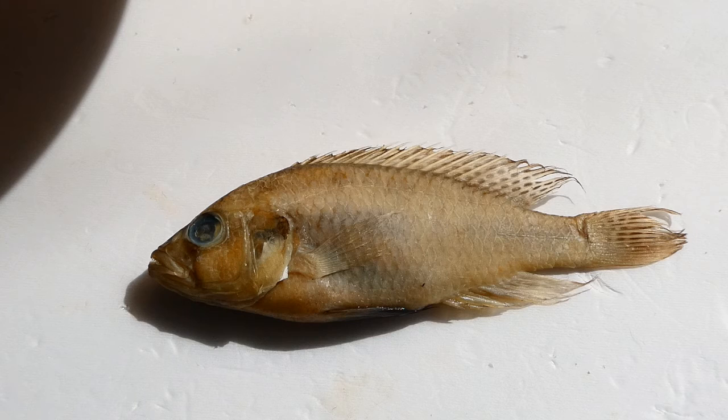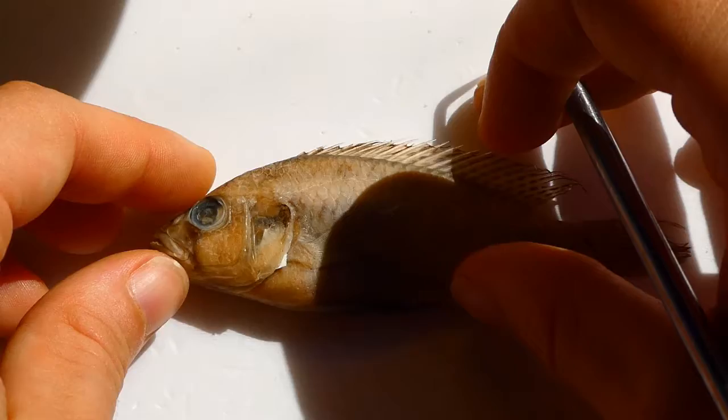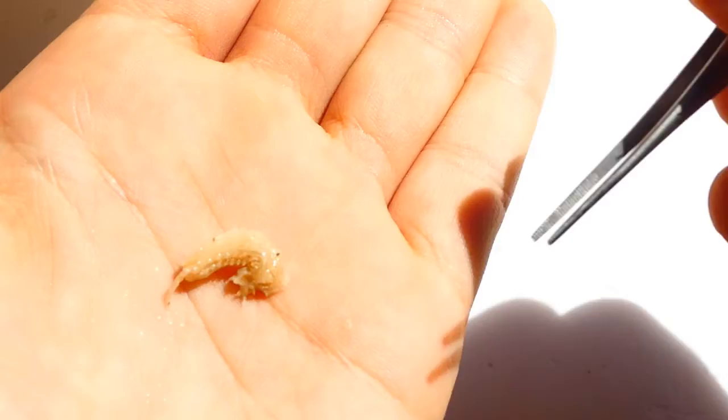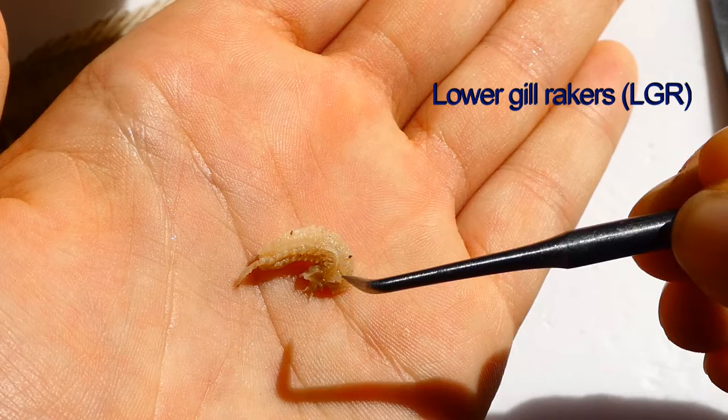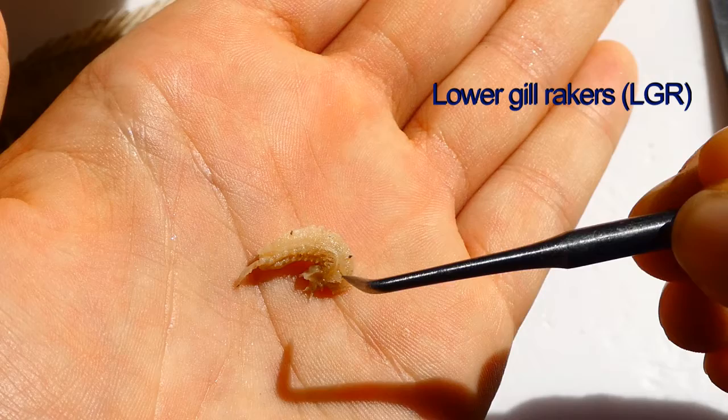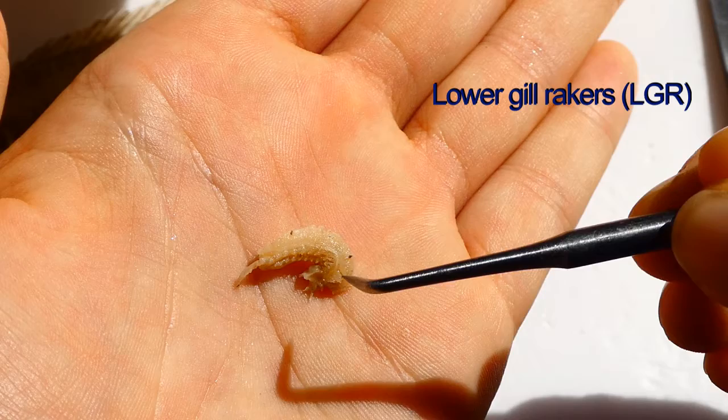These are the main discrete measurements you do on the outside of the fish. You can also do some inside. So we could count the number of rakers — here we've already dissected this out — and then we could count the number of rakers on the lower limb, on the upper limb, and on the joint.